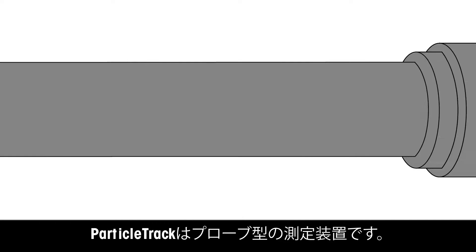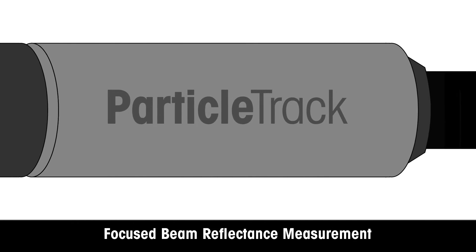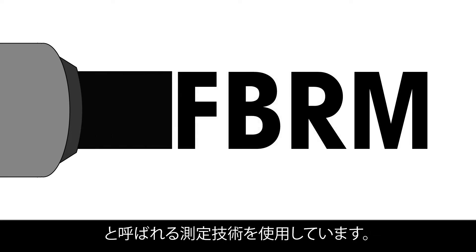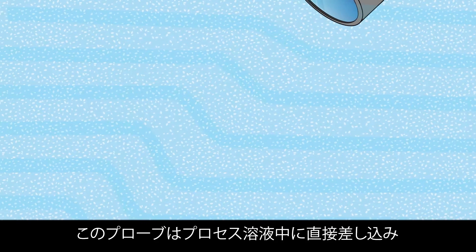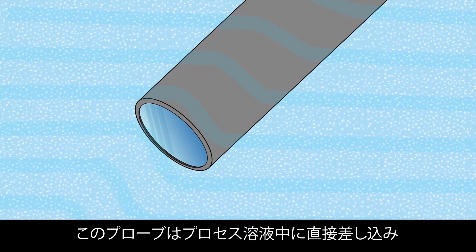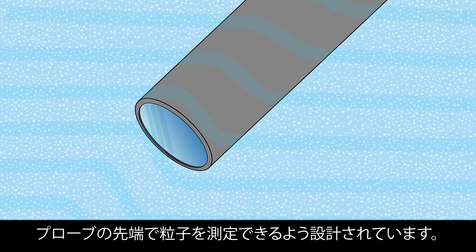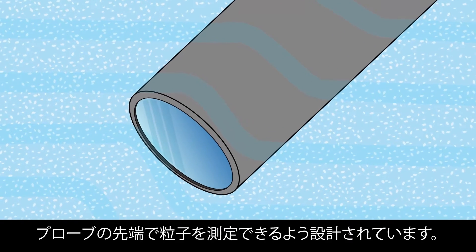ParticleTrack is a probe-based instrument that uses a measurement technique called focused beam reflectance measurement. The probe is inserted directly into process streams at an angle to ensure particles can flow easily across the probe window where the measurement takes place.